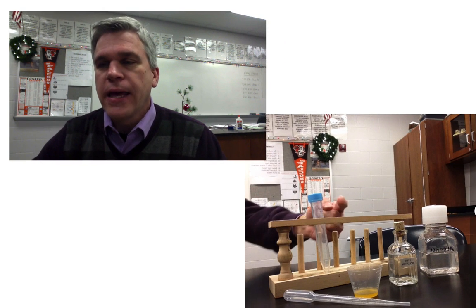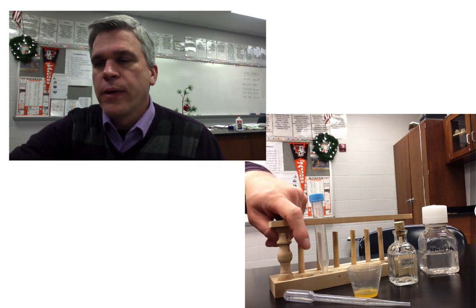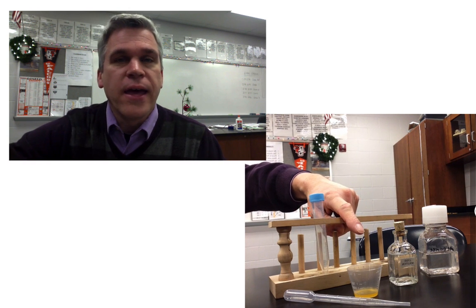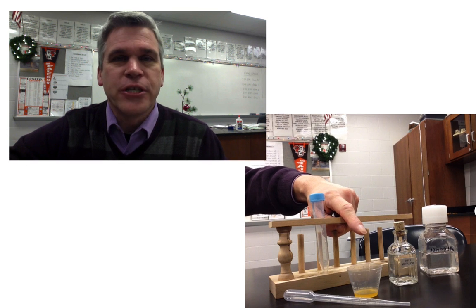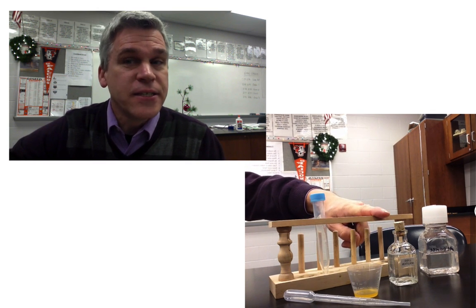We're going to need to get some materials together. You're going to need a test tube rack with a special type of test tube in it, a plastic dropper, an electrolytic solution that will get our cheek cells from inside our mouth, a lysis solution, and a nice ice cold bottle of alcohol.